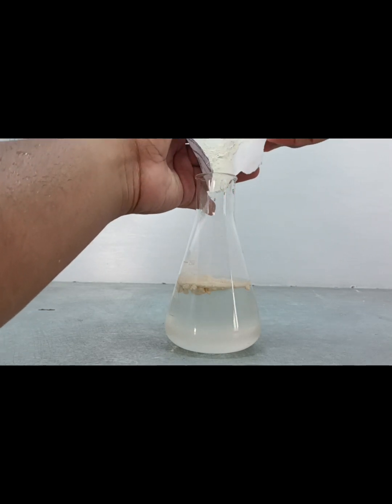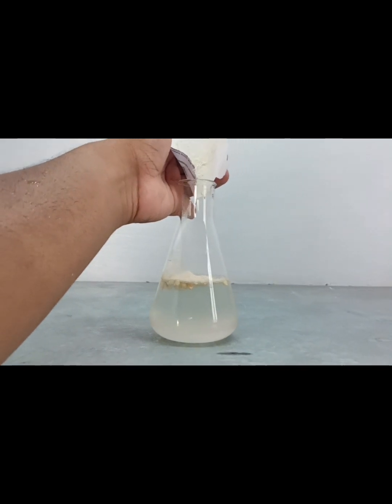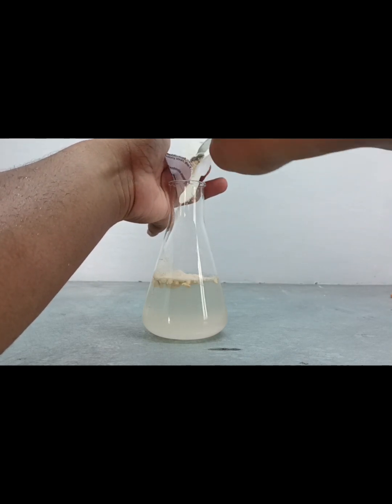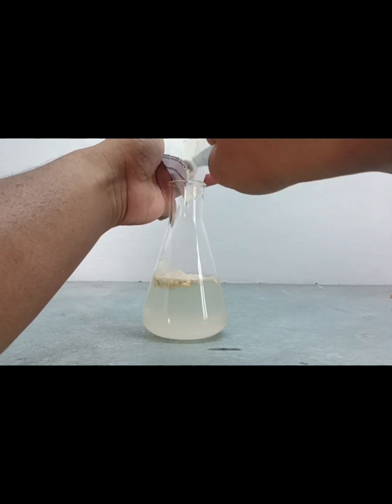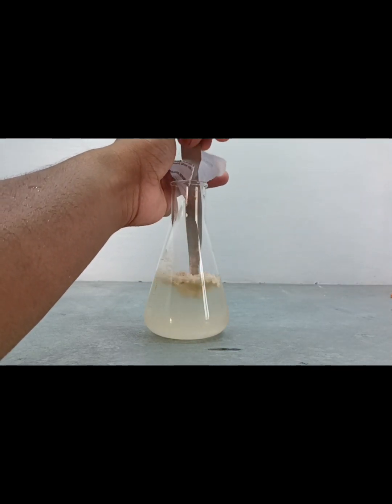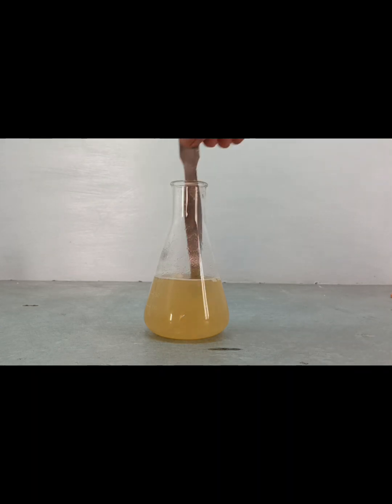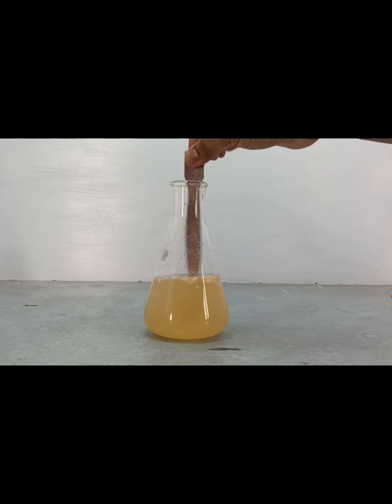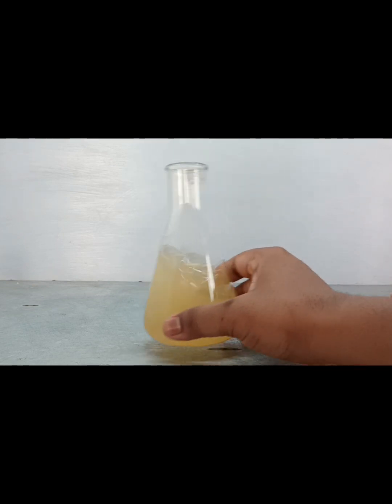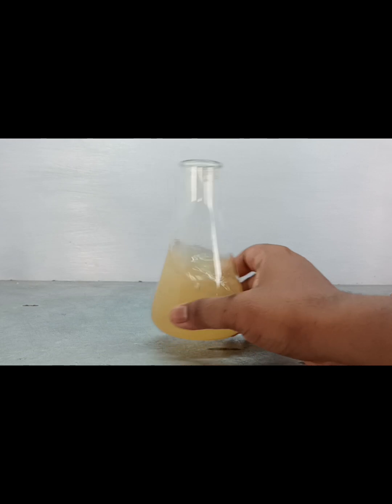After measurement, we mix the agar powder into the sterile distilled water. We see that a small amount of Mueller Hinton agar powder is stuck to the paper, and we remove that with the help of a spatula. After that, we mix it properly with the spatula, tilting the reagent so the Mueller Hinton agar powder mixes well with the sterile distilled water.